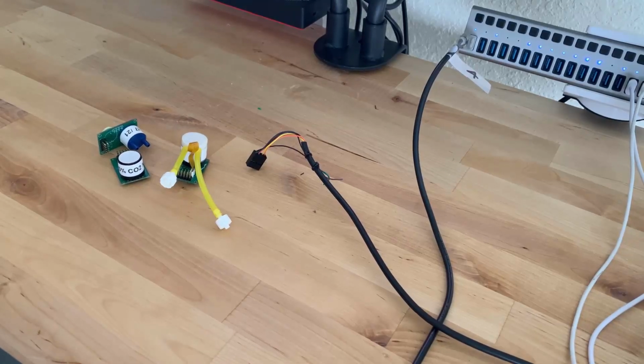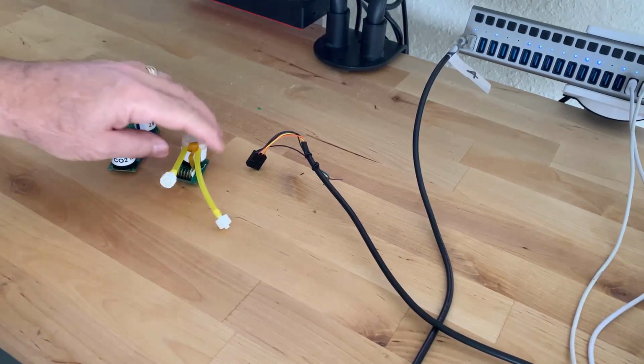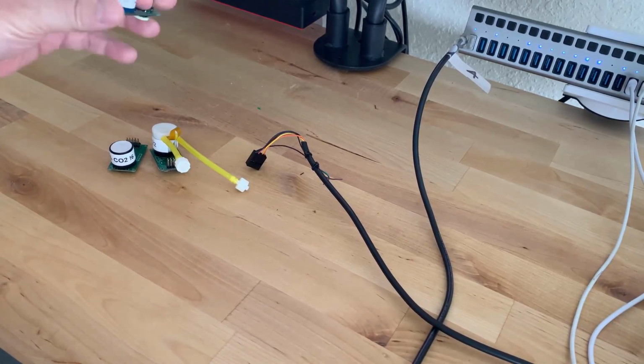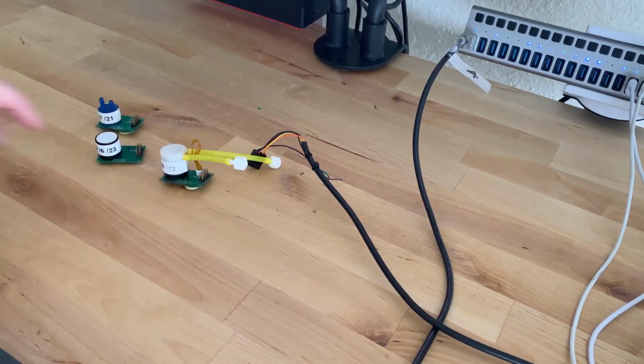Good morning. I'm going to demonstrate how to hook up RS485 to a group of sensors so that we can daisy chain these sensors together on one loop. The first thing we have to do is get addresses. I happen to have assigned them already to these guys, but I want to show you how.